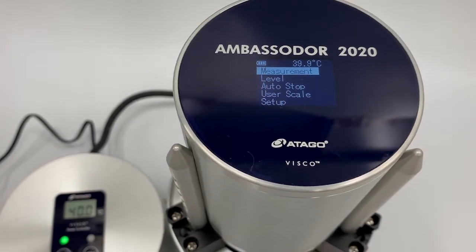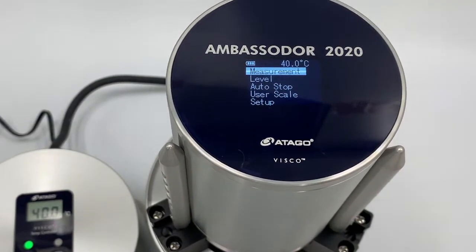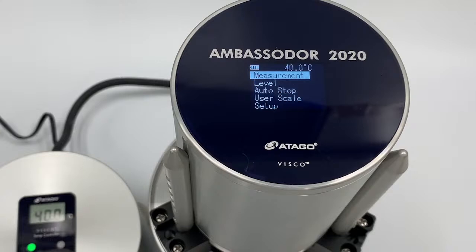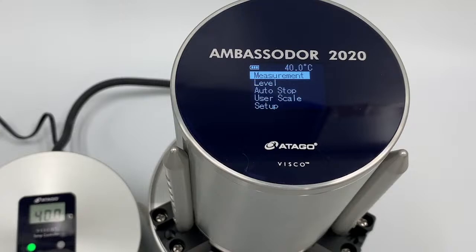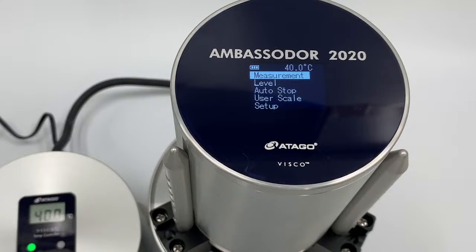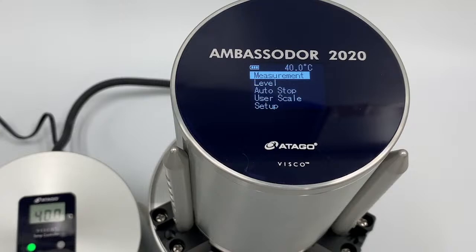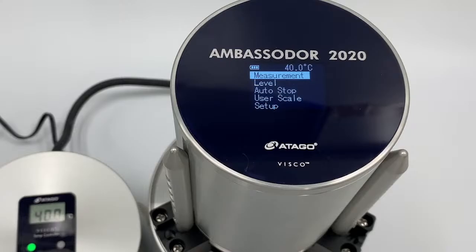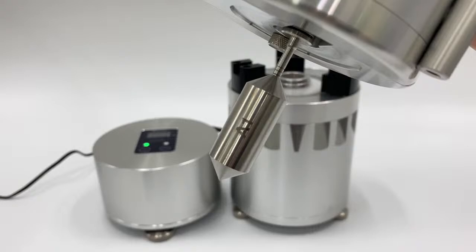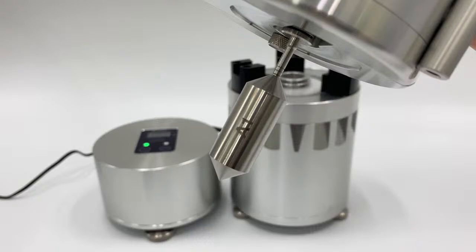Here we see the sample hitting 40°C. Once the sample temperature and controller temperature both read 40°C, you're ready. In some cases — as with a later example — the sample only reached 39.8°C, so the controller had to be adjusted up to 40.2°C to bring the sample to 40.0°C. Once the target temperature is reached, remove the temperature sensor and insert the spindle you're going to use. We filled to the first line because we're using the A1 spindle.